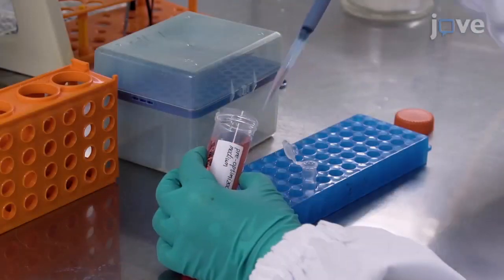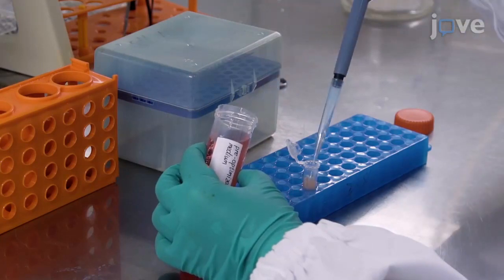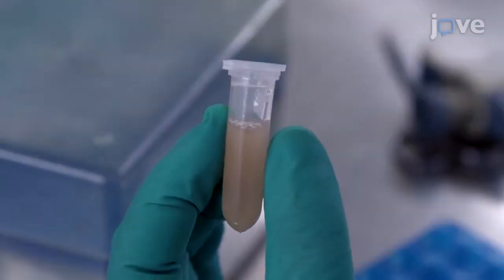Add 1.5 ml of pre-optimized culture medium to the sea cucumber intestinal tissue block and mince the block with sterilized surgical scissors until the solution is cloudy.